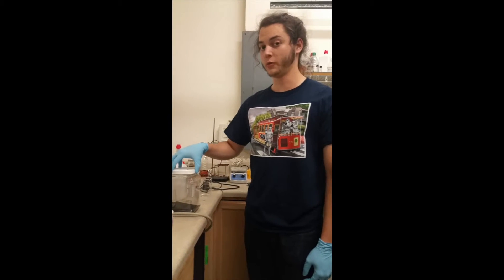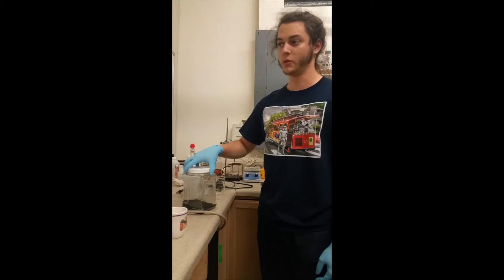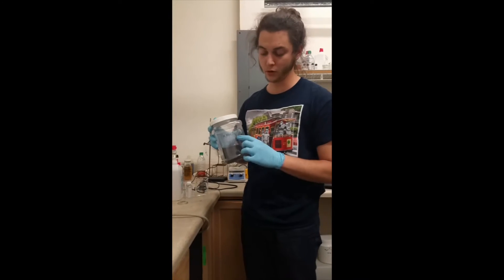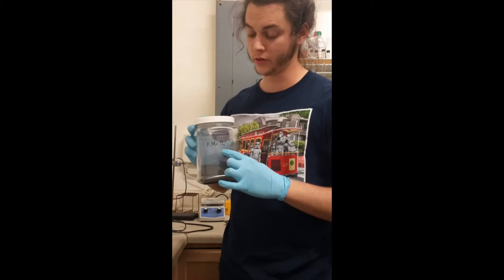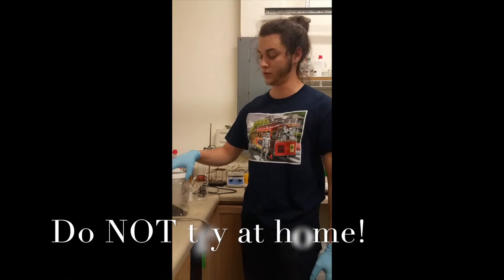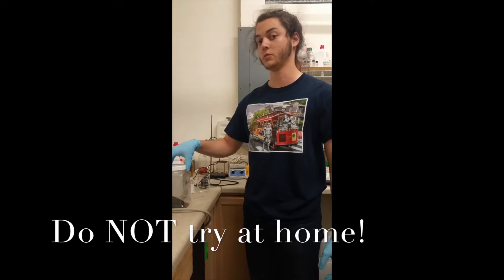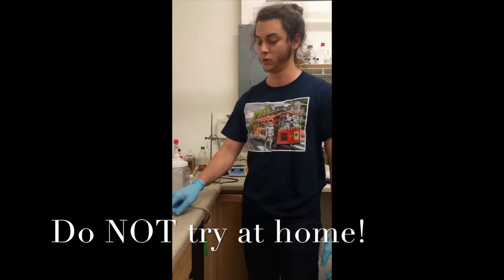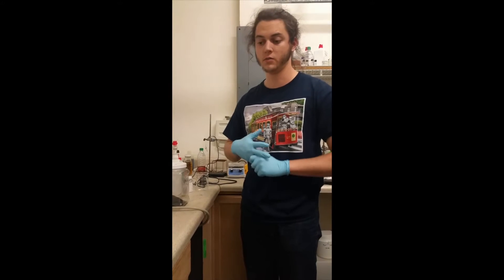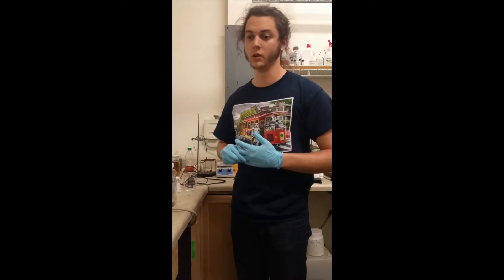Since it's really fun and I've done it before at night, I'm going to give a little demonstration of mixing potassium permanganate with some glycerin and watching the wonderful, awesome flame that it makes, which is super cool. I'm going to show the procedure really quick on how I mix things together and then just watch the flame. It should be really quick.